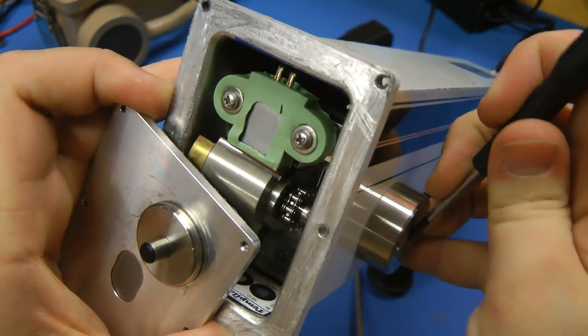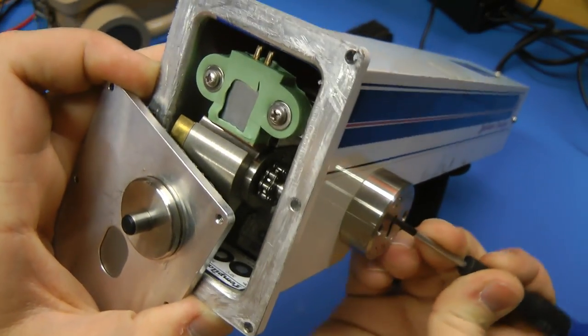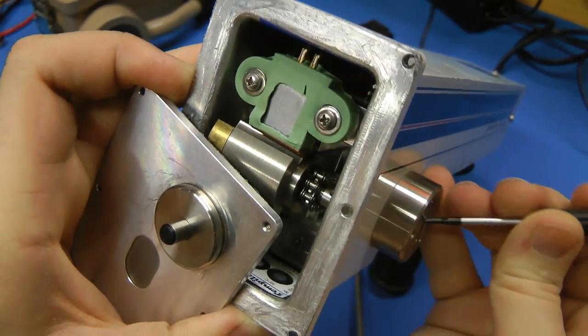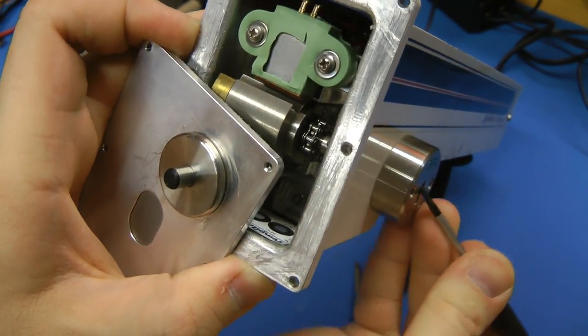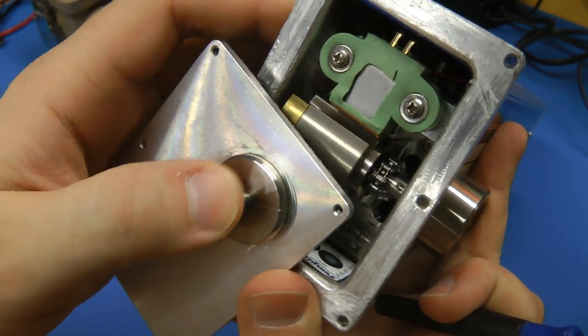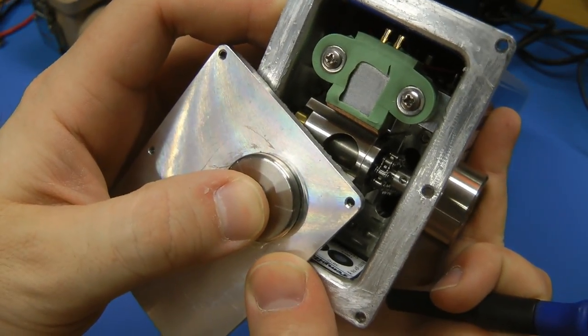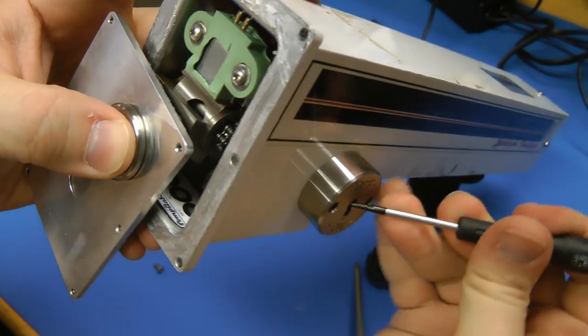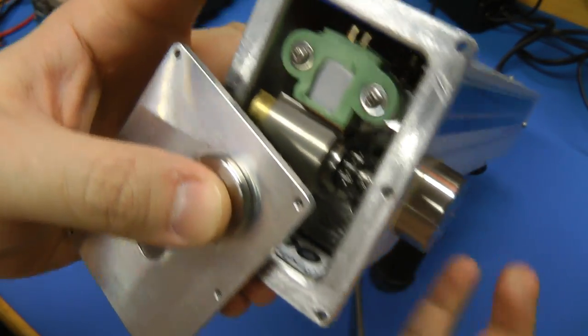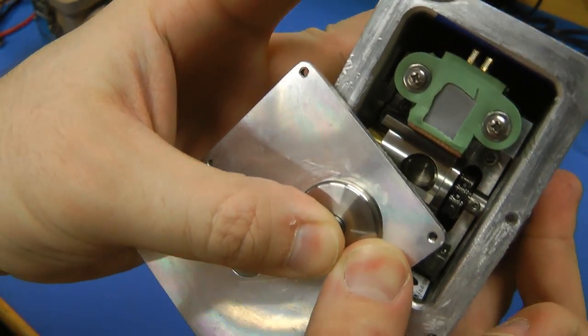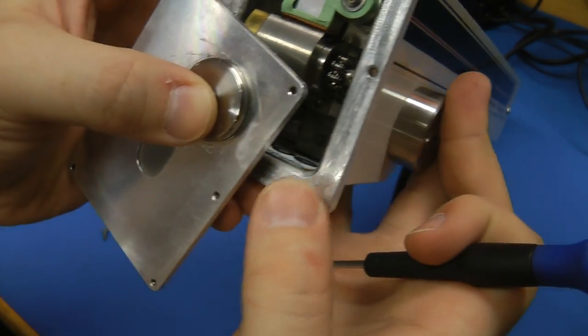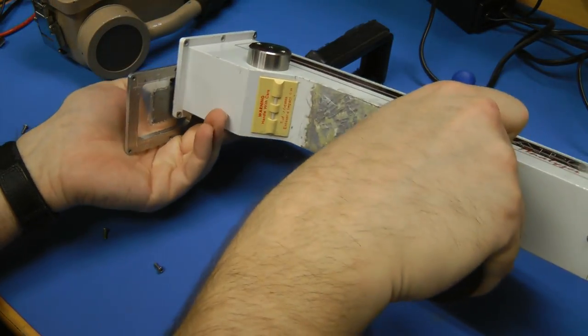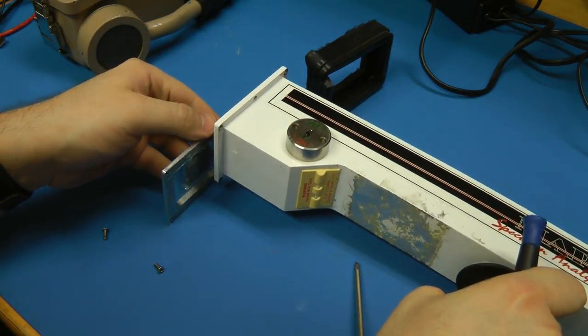Yeah, it seems like when you turn this, it turns this chain, which that must turn the source from the safe side to the active side. And then this thing, aha! That exposes it. Put that back to the armed side. Yeah, you can see in there. I don't see anything in the source compartment. Definitely nothing is coming up on the Geiger counter when I open that.